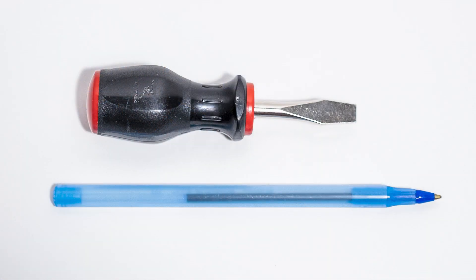If your centrifuge loses power while locked, or the stop/unlock button otherwise becomes disabled, you'll need to use the emergency unlock. To use the emergency unlock, you'll need a flat object to peel up one of your centrifuge's labels and a pointed object to pull the unlock switch. We use a flathead screwdriver and a pen, but any similar objects will work.